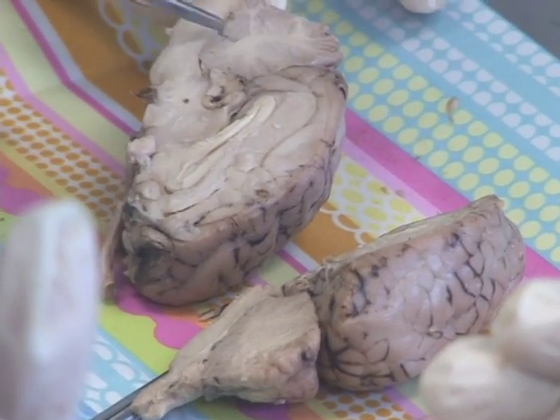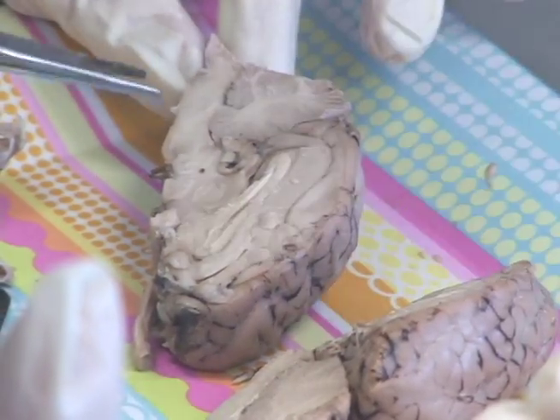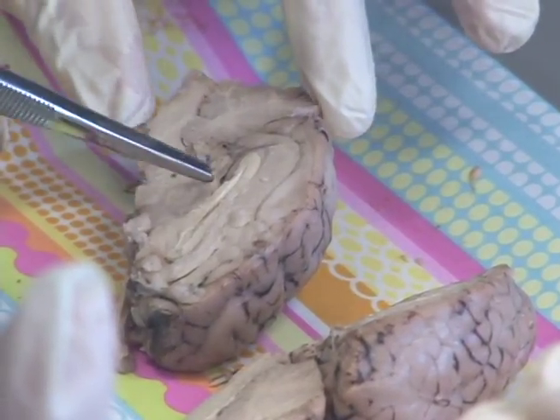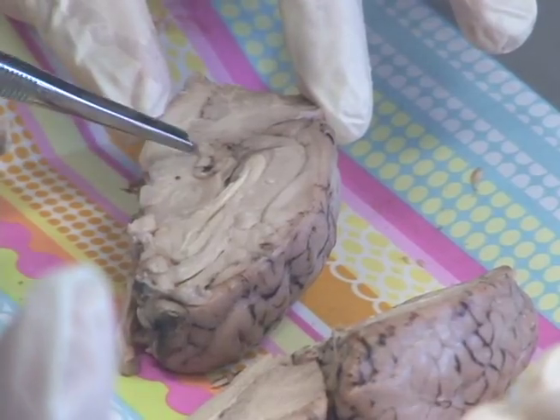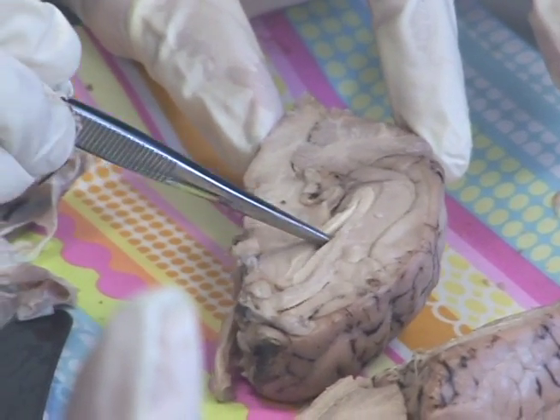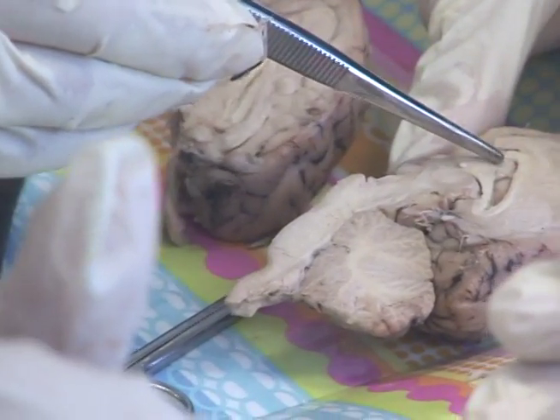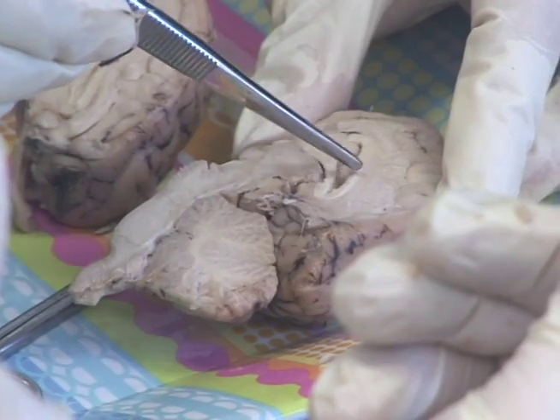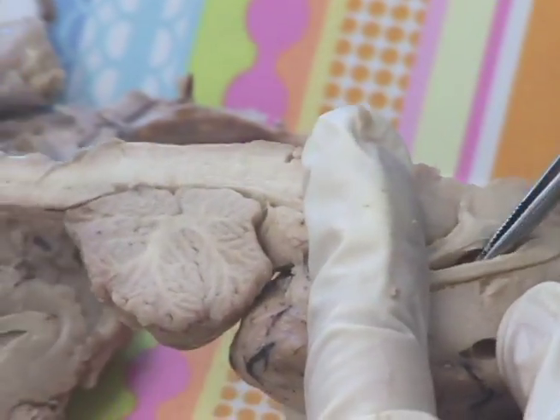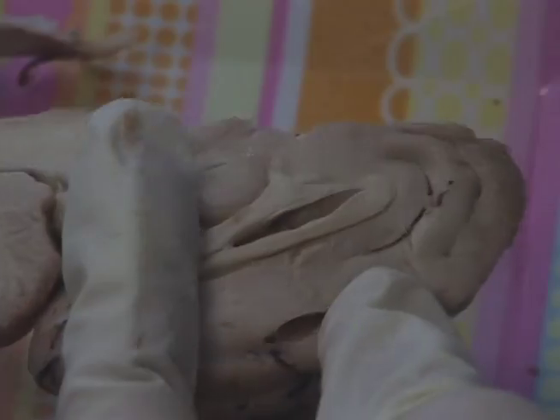Can you identify white matter and gray matter in your cerebellum? The white matter would be in the middle — the branching structures — and the gray matter is on the surface. Yes, absolutely. So this is thalamus, this is hypothalamus. Right here was your pituitary coming in. There's half of your optic chiasm. This is another white matter tract called the fornix. This is the corpus callosum — the connections that go from the left side to the right side; these are all axons. That's called the choroid plexus, and that's what makes the cerebrospinal fluid.